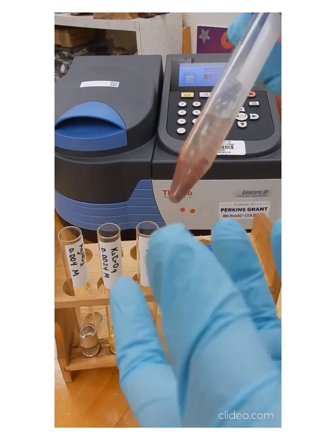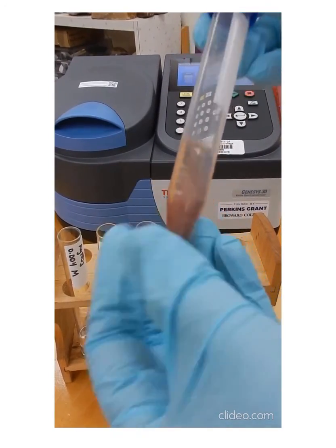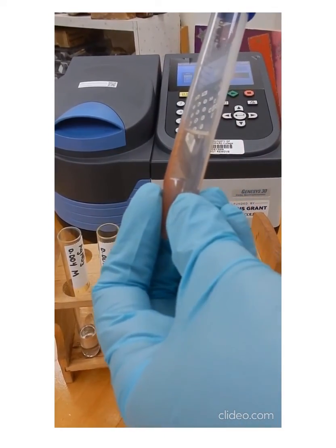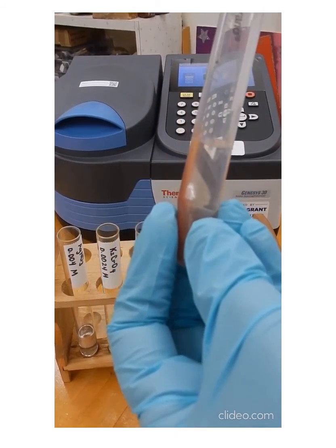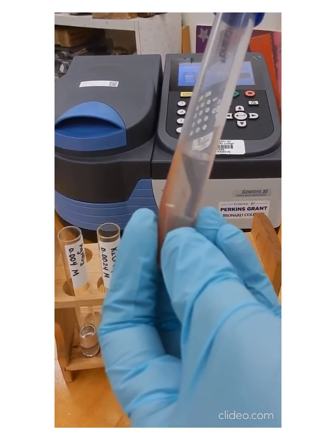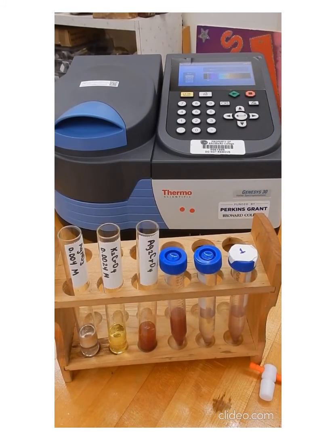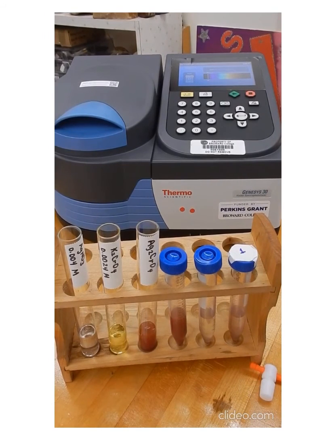some ions in solution. So we do that, and we centrifuge our sample, and after we centrifuge our sample, we're going to remove the liquid, but now we're not discarding that liquid. Now we're actually transferring that liquid into a cuvette so you can determine the absorbance of your sample. So I have here my sample in a cuvette that I already transferred, and now we can just measure the absorbance for your sample that you have in your cuvette, and that's the absorbance that we're using for the chromate ion.